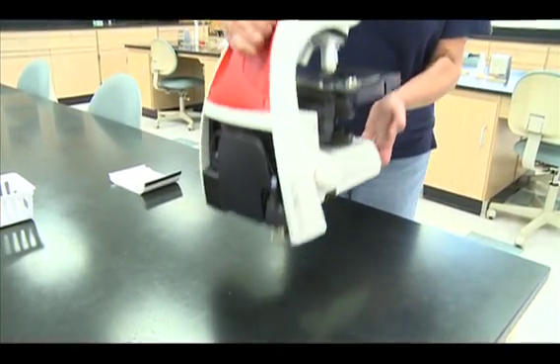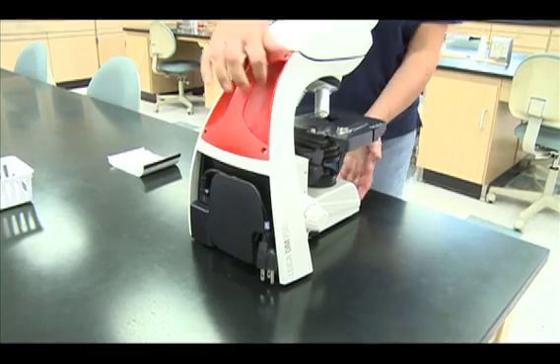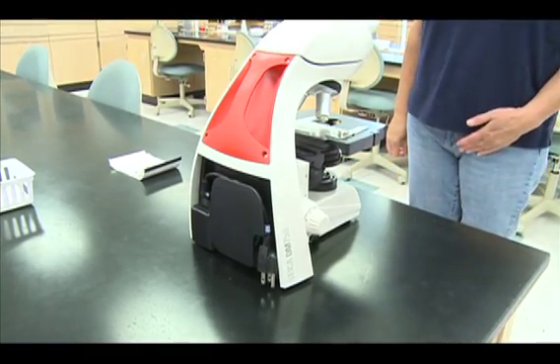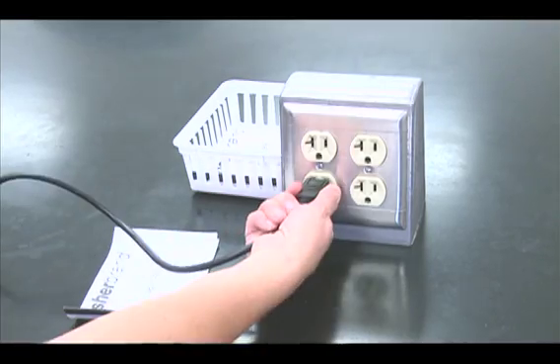Carry the microscope by the arm and the base. Plug in the microscope.